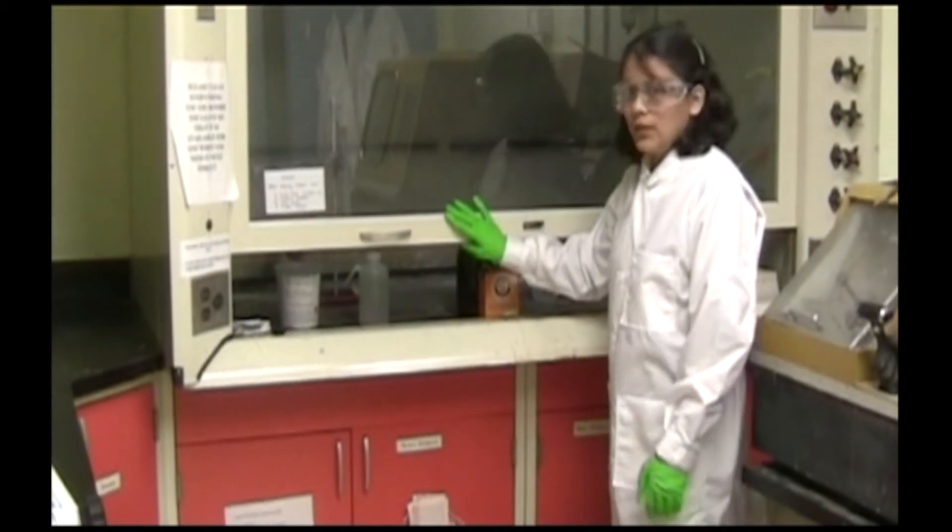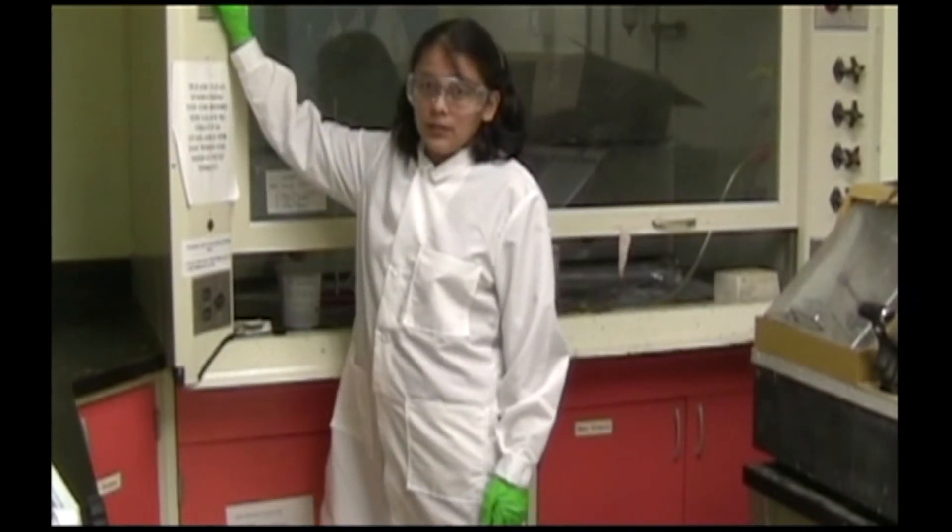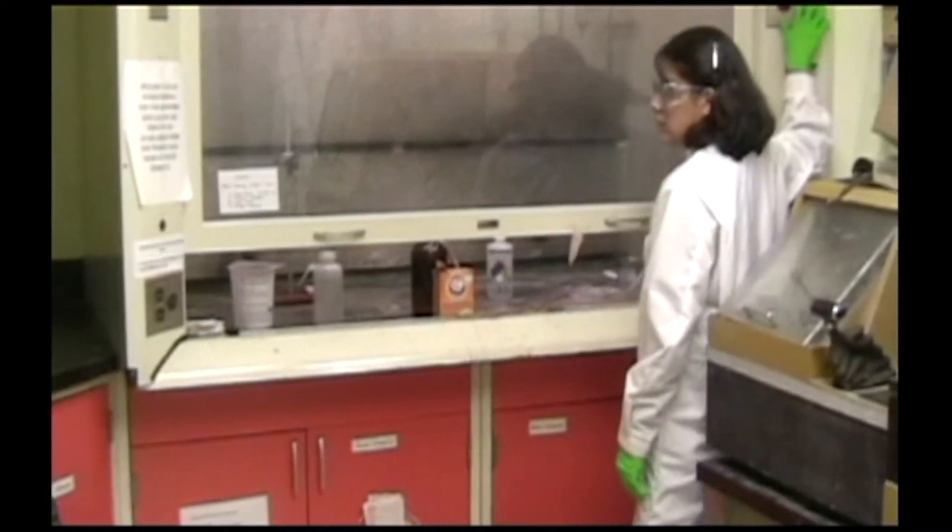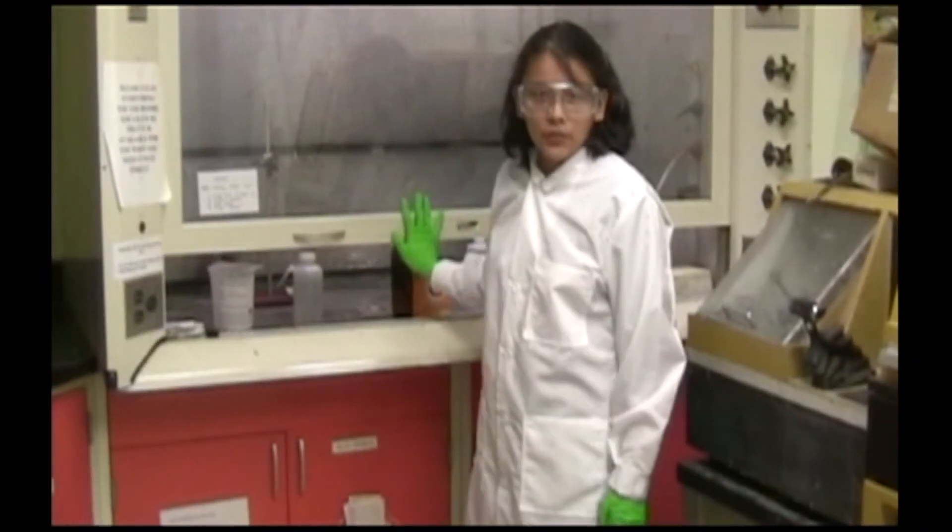You should do the etching in this hood with the light on so that you can see, and the air on. But I'll leave the air off so that you can hear me.